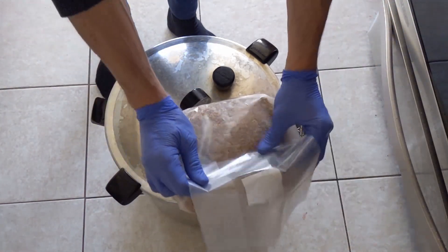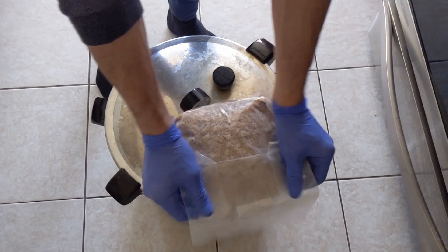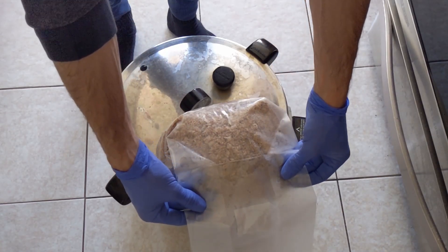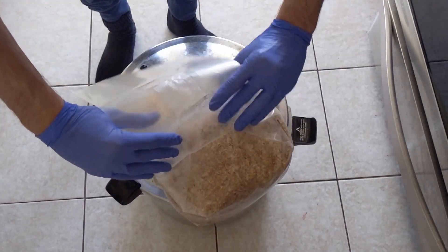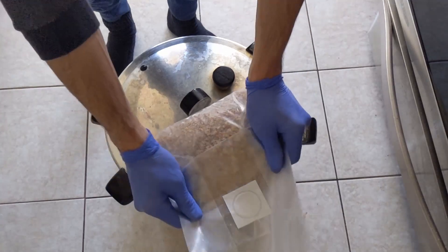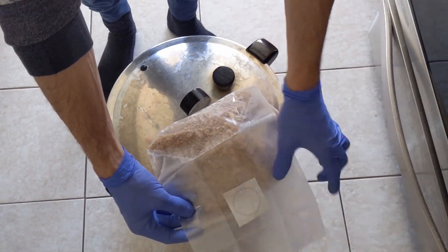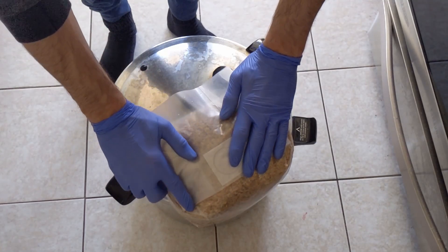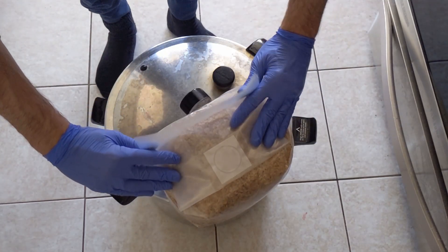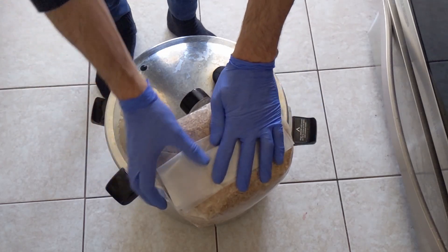I'll do the same thing, get all the air out. And then once I'm at the bottom, instead of pulling it under, what I'll do is I'll get my filter patch and I'll fold it so that my filter patch right here gets folded right here. Then I will take the top right here and fold it one more time.